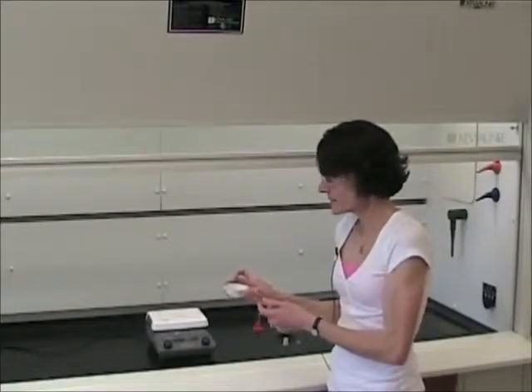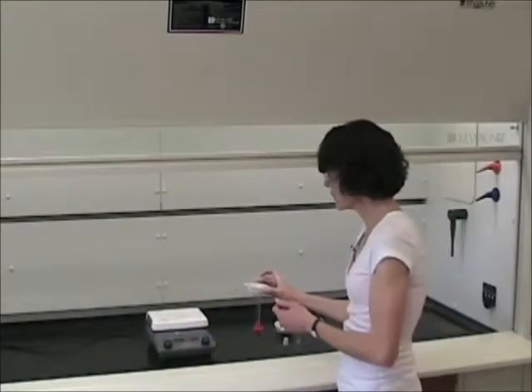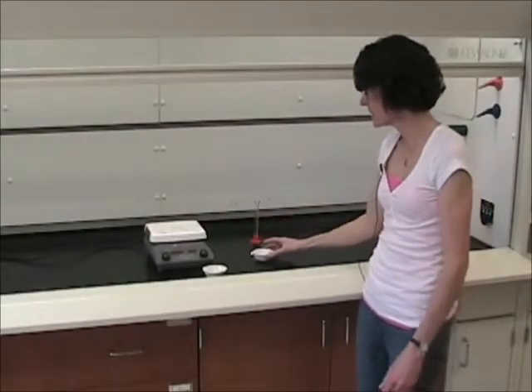At that point, you will then separate the silicon dioxide and the sodium chloride by undergoing a technique called decanting. When you decant, what you do is you pour a liquid or a solution off of a solid substance, thus separating the two. So you will decant the sodium chloride solution from the solid silicon dioxide by pouring the sodium chloride solution into a new evaporating dish.